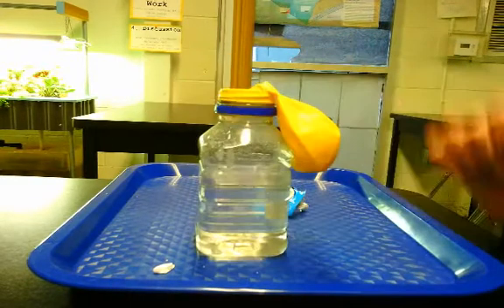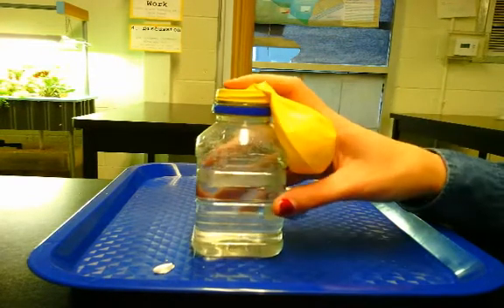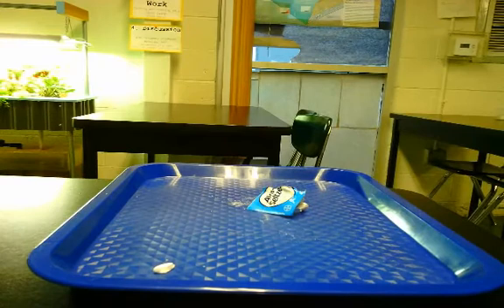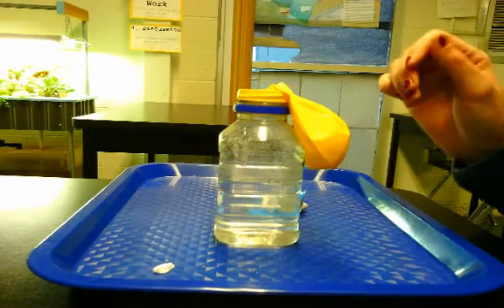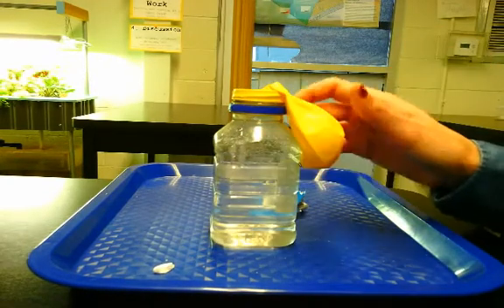There we go, I'm all set up. Now I'll take this whole system and go measure the mass. Once I'm done measuring the mass, I bring it back to my table group and we're ready to do the experiment.